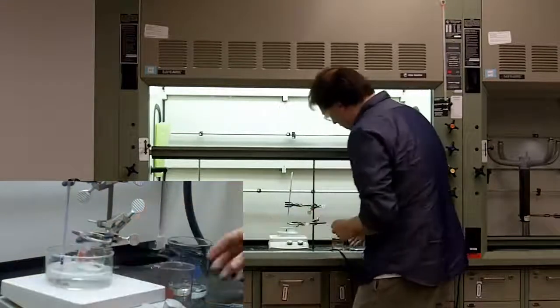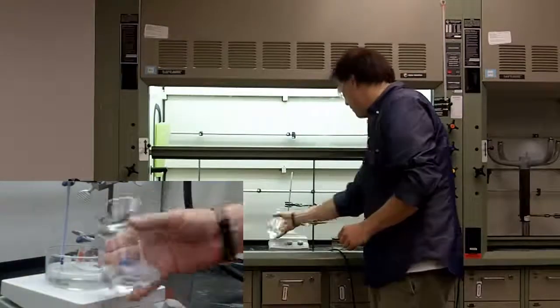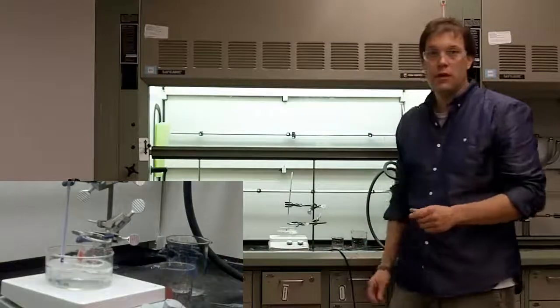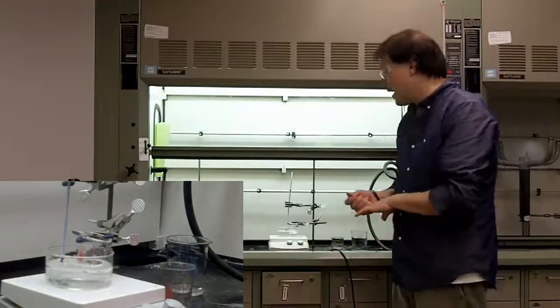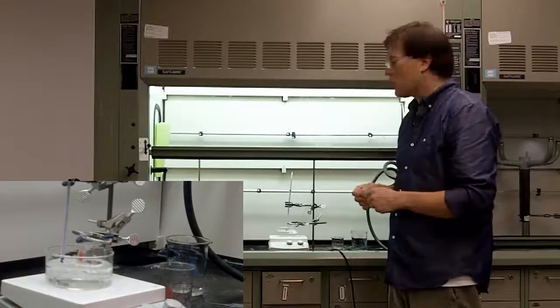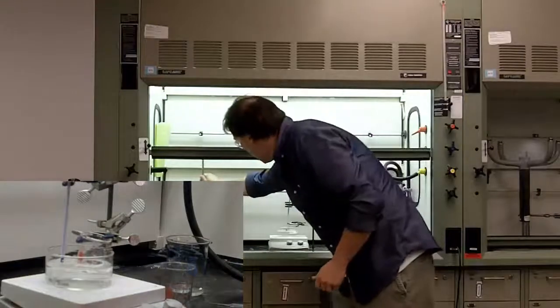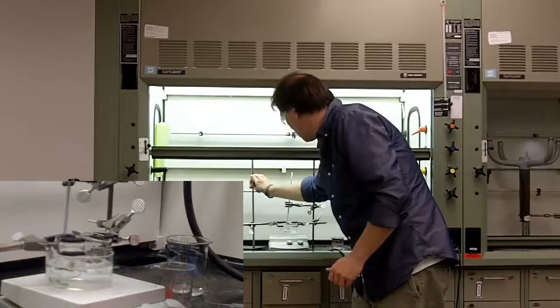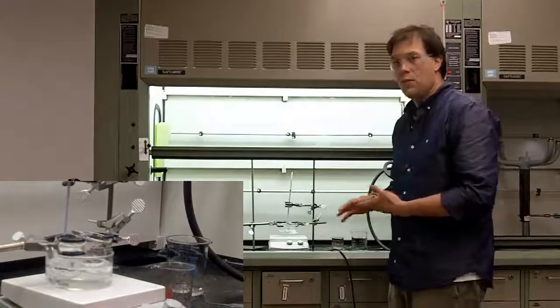So, there we have our beaker in and we also have the thermometer so that we can measure the temperature and so forth. But this time, to actually maintain the temperature on the solvent we're transferring in, all you need to do is add a second beaker with the solvent you're going to be using to the same water bath.